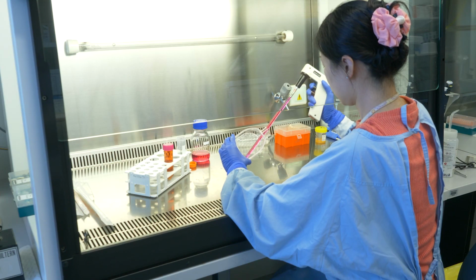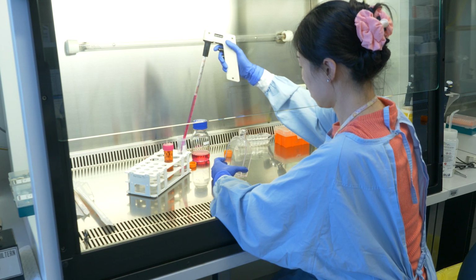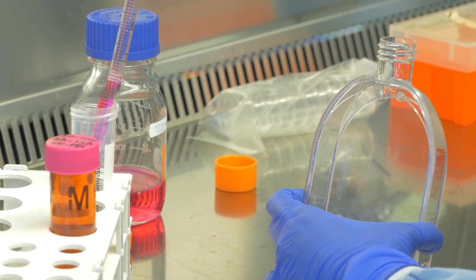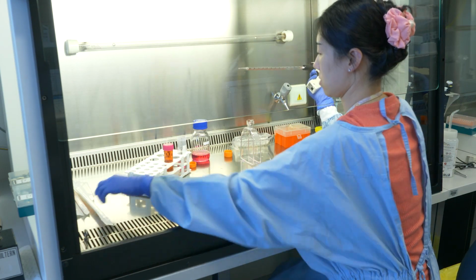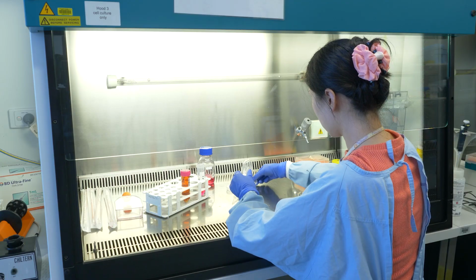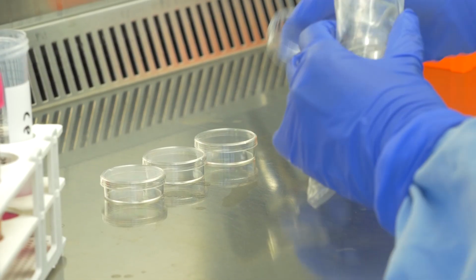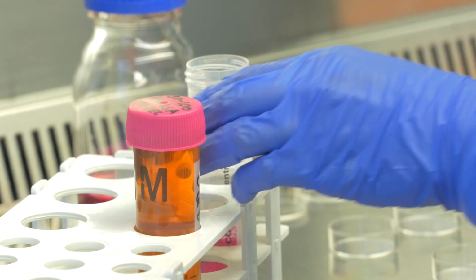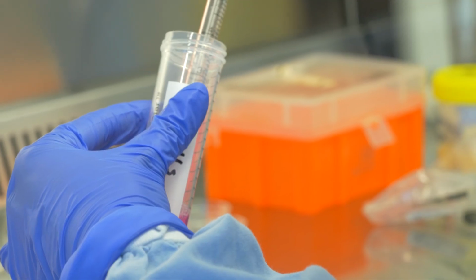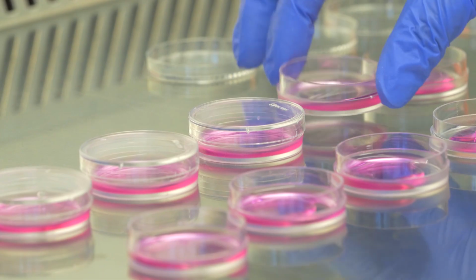Okay, now we are going to use these cells for our experiments. That's right, we are using these cells for intracellular ferric ion sensing using carbon quantum dots as a biosensor. First of all, we need different culture dishes to make our samples. You will see why we need different dishes later. JJ will transfer 1 ml of the media containing the cells to each dish and make sure the media covers the entire bottom surface of the dishes and put the lid back on.